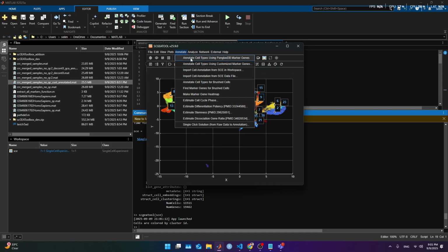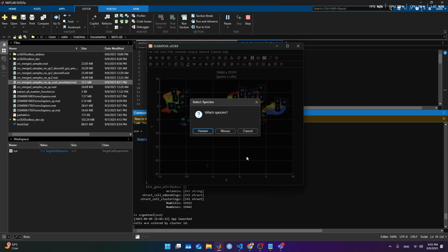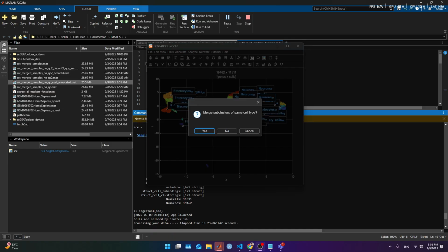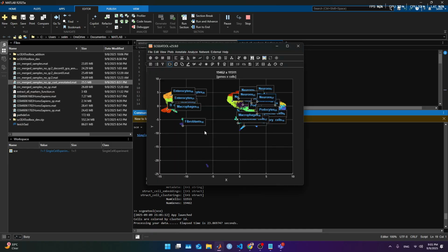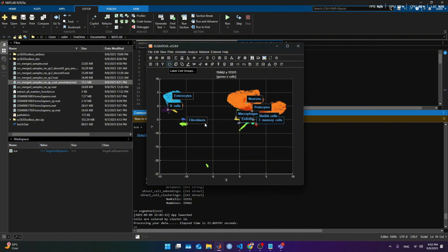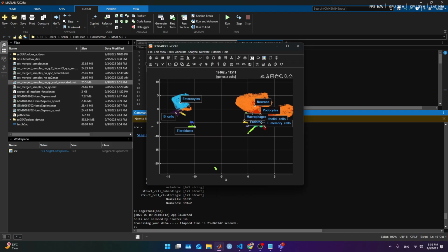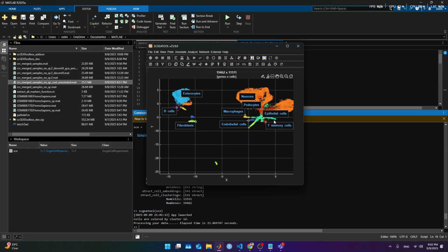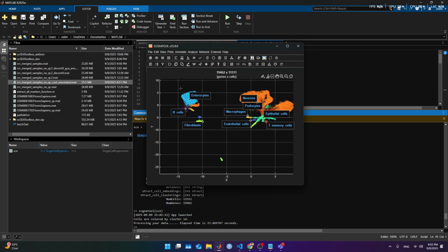And we can annotate with Panglao. And okay, it's human and automatically. Gonna stop it for now. Okay, it finished. Now we merge the cell types, and we have a little more cells. Indeed, we got quite more B cells. And now we kept some T cells. So it is important to be careful with this. And now we don't seem to have, no, we have the drift.